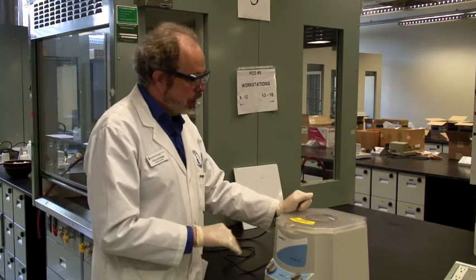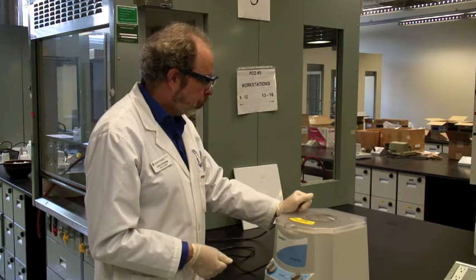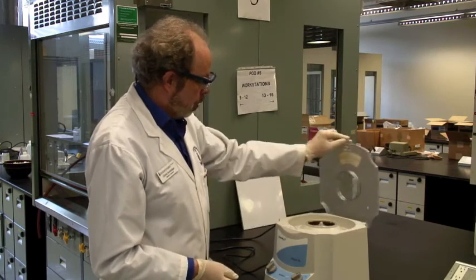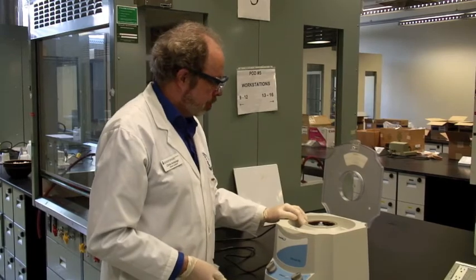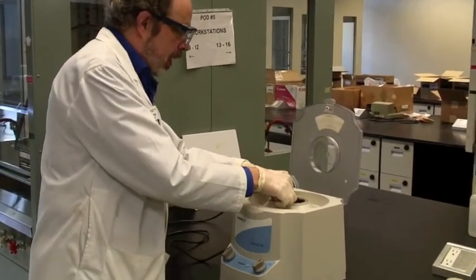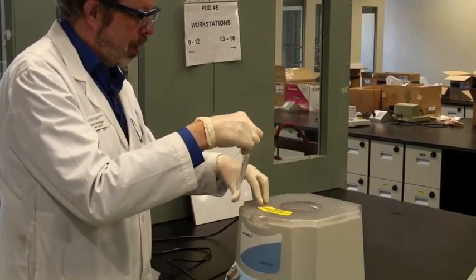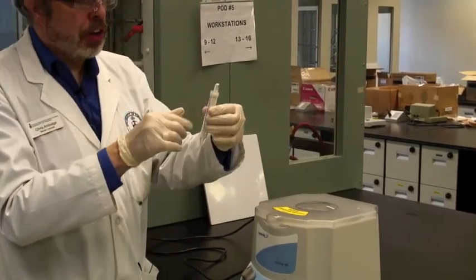All right, we've now got the centrifuge stopped. Just run it for about a minute. And once you're ready to go, there we are. Take yours out, and again, remember that you need to remember which slot is yours.